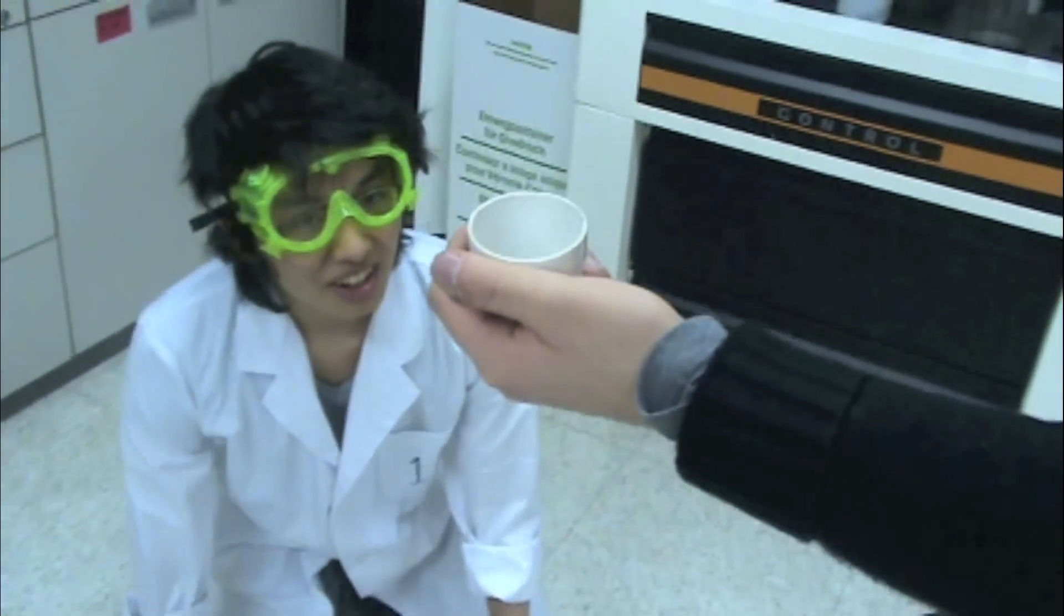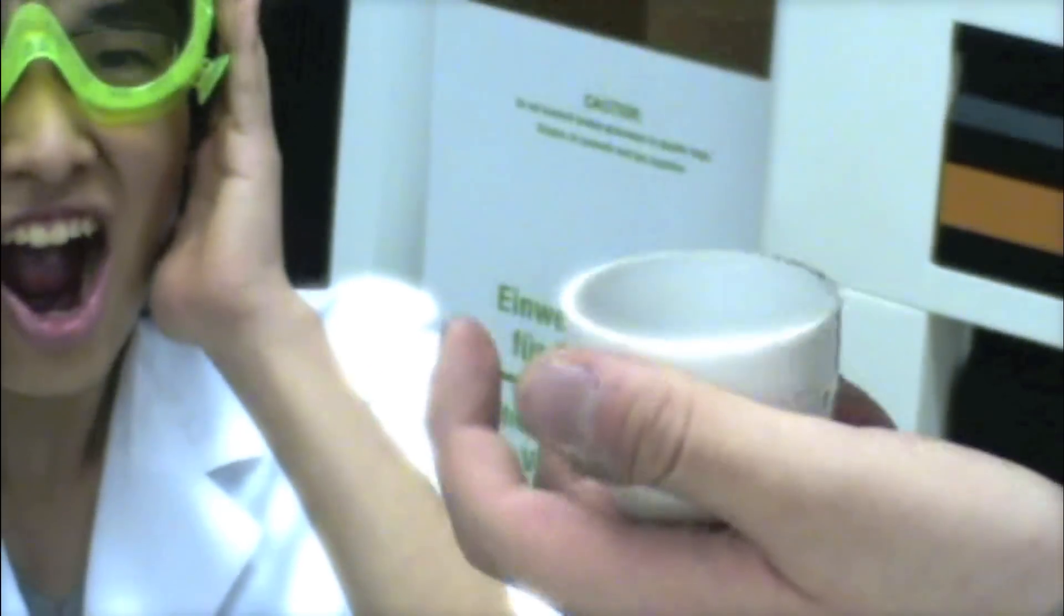The crucible and the lid. The crucible and the lid? That's right. The crucible and the lid.